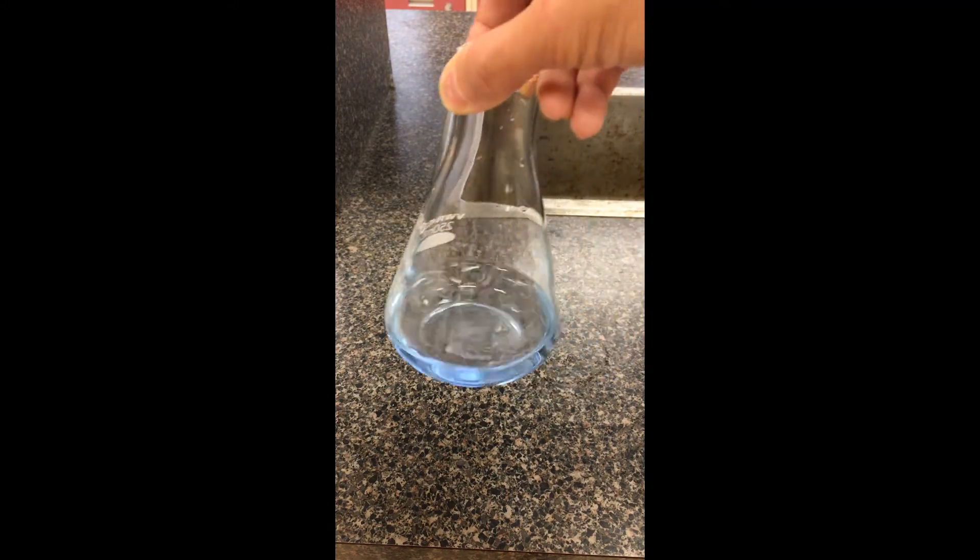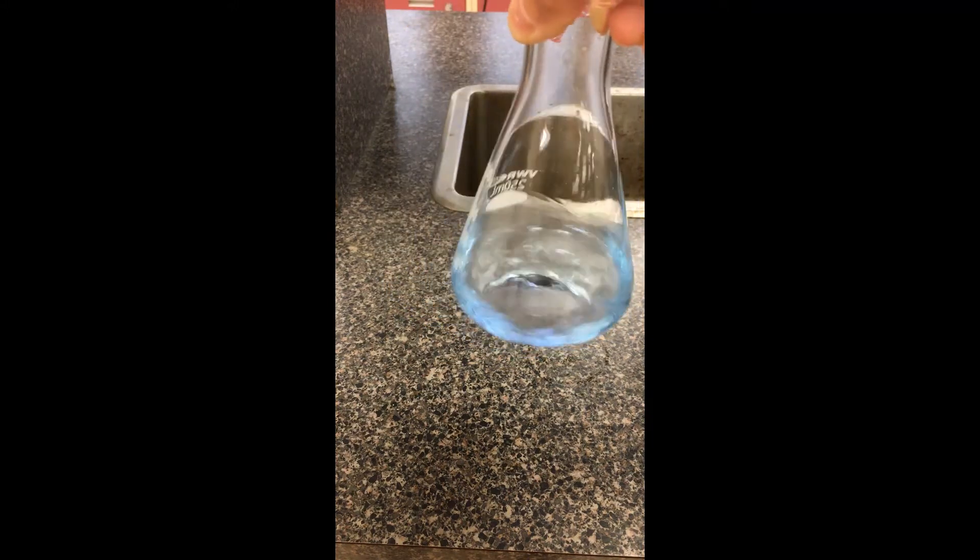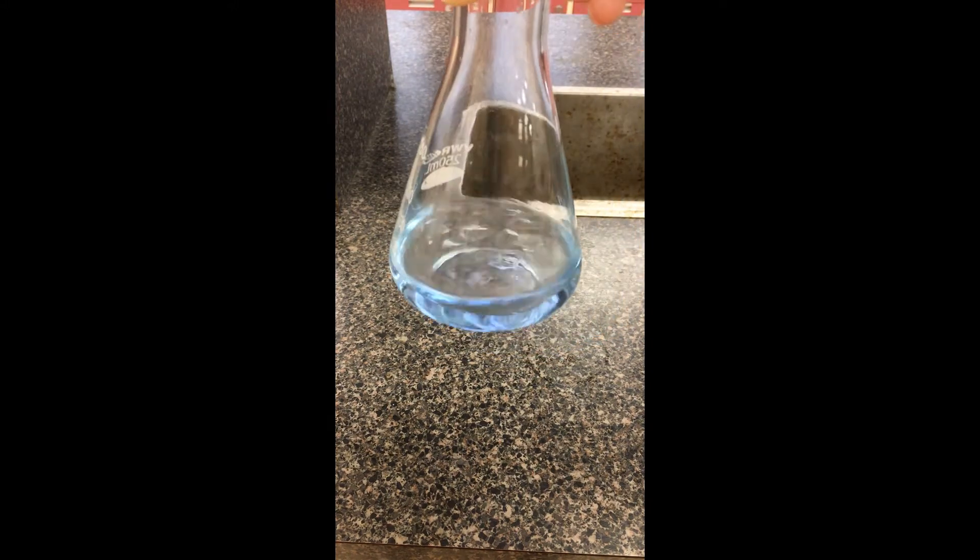Just for argument's sake I'm going to add acid again here. If I can neutralize some of that base, I should be able to get rid of this blue color. Thymol blue is a very special indicator that actually has two endpoints — we'll see in a later chapter. If I had stronger acid and stronger base, I should be able to see one other color change. Based on the concentrations we have, in basic solution it's more of a blue tone, and adding more acid pushes it toward yellow. That's station one — thanks guys.